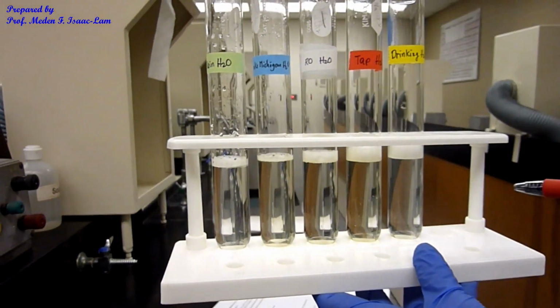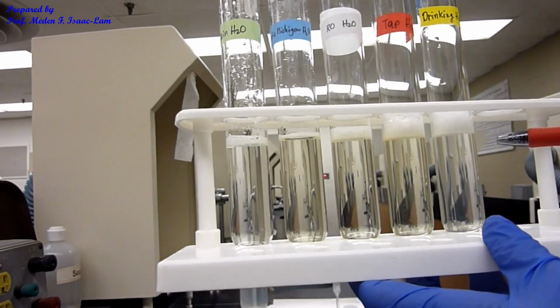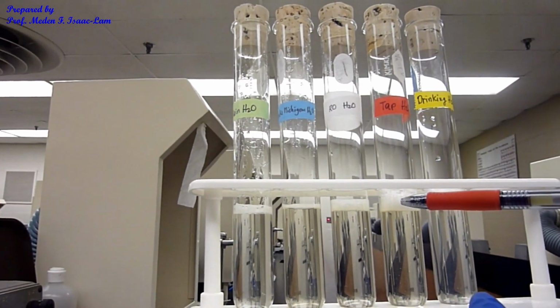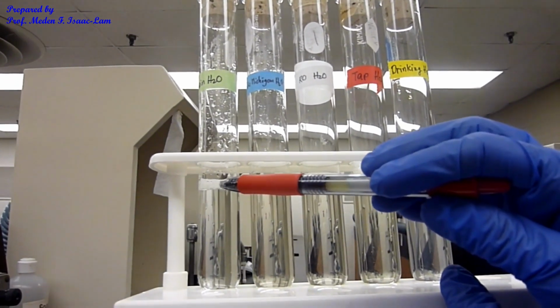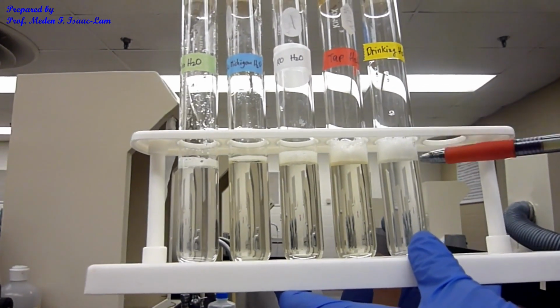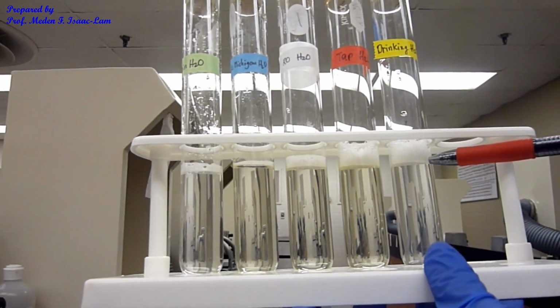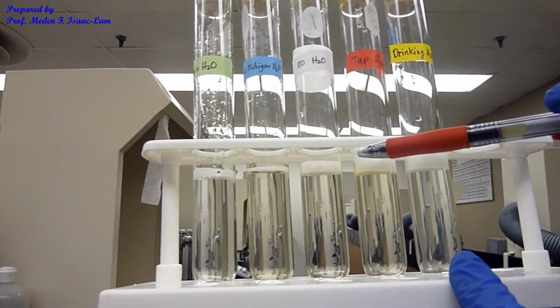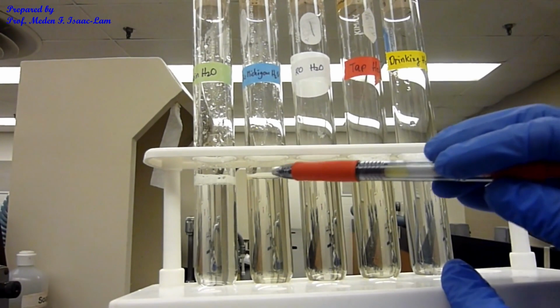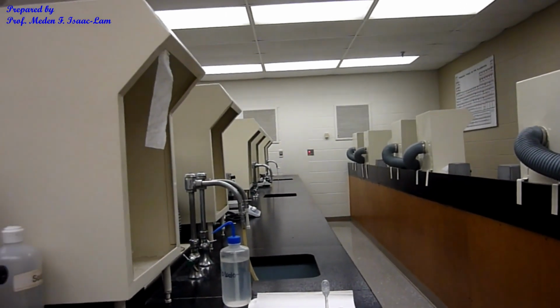Okay, after shaking the sample for 10 seconds, actually I shook more, maybe 20 seconds. So as you can see, the most suds actually on the drinking water, and then tap water, followed by the RO water, and then the rainwater, and then the least is Lake Michigan water. So again, the most bubbles on top, the drinking water in Westville, in the third floor of Swartz building, and then the tap water, followed by the RO water. This is our RO water, and then the rainwater, and then the least is Lake Michigan water.